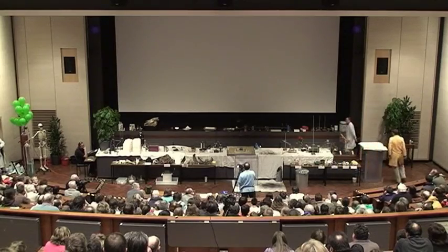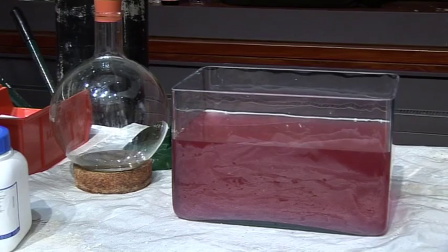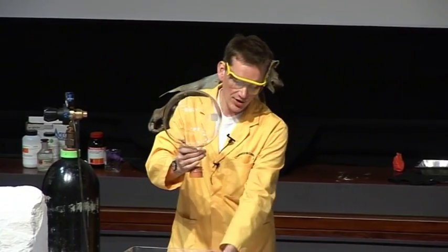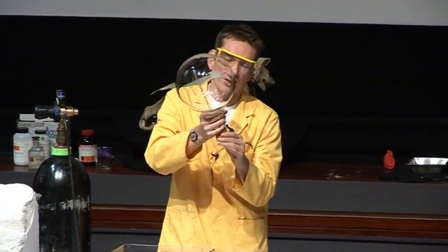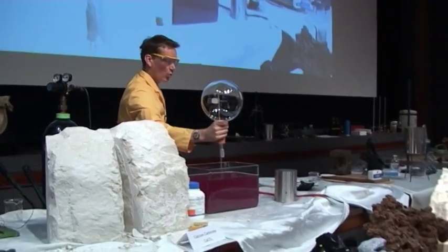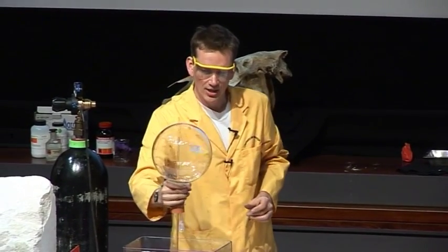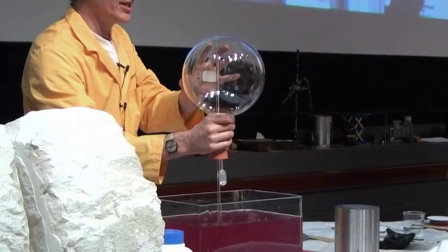Another property of ammonia is that it's very, very soluble in water. We have a flask over here that is filled up with ammonia, and I'm going to stick another tube in this. This bung here has a tube running right the way through it, so it's open to the air, but I'm going to lower this into the water here and add a little bit of extra water into the flask, and the ammonia instantly dissolves in that tiny little bit of water that I squirted in.